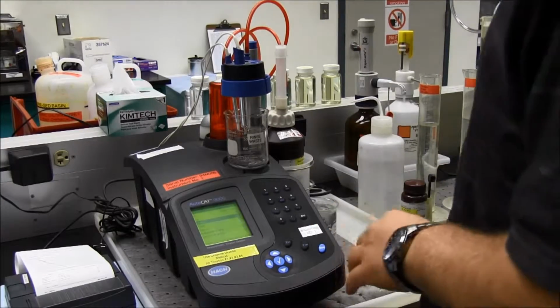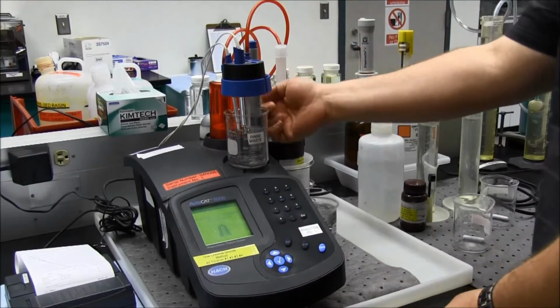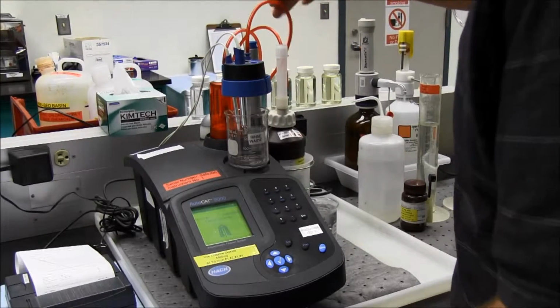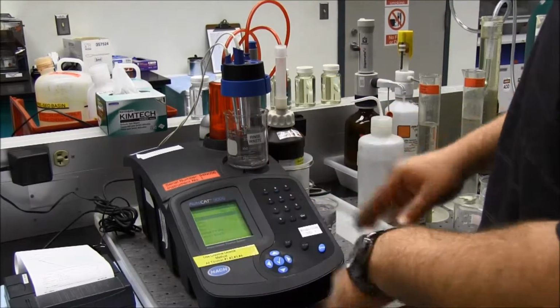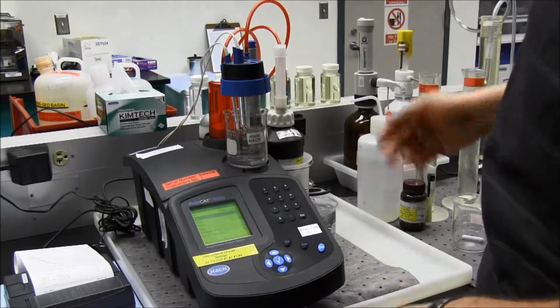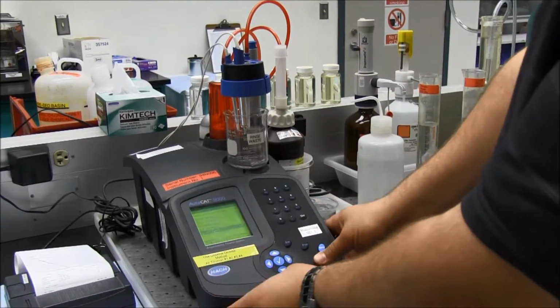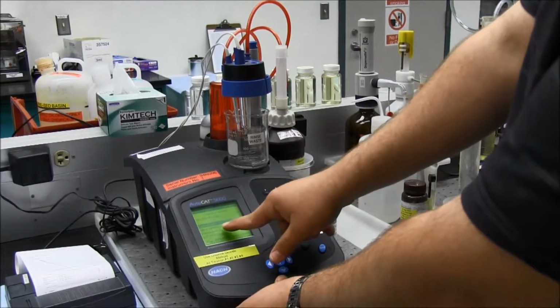So now it's empty. Now I'm going to fill it. That's number 1. I will hit number 1, and it will fill from there. So now that that's done, everything should be good there. We've verified that there are no air bubbles in there or in any of these lines that we can see visibly. So we're going to escape to get out of the burette functions menu, and then we're going to tab over using the arrow. Now this is the main screen where we're going to run the test.